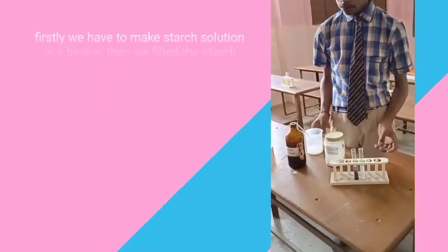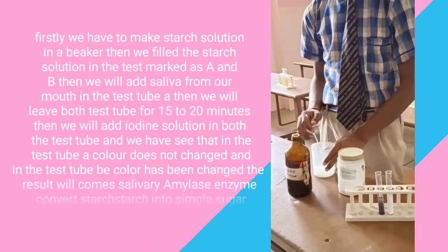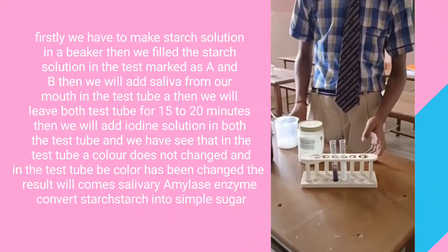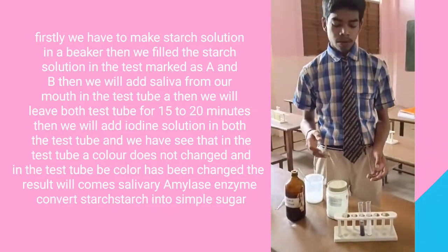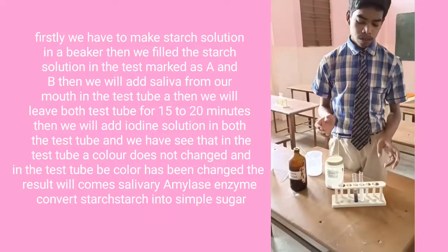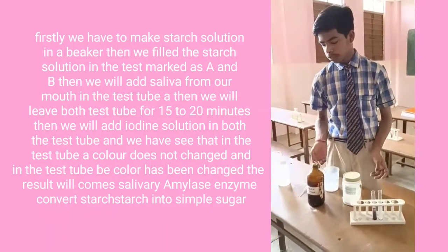Firstly, we have to make starch solution in a beaker. Then we will fill starch solution in both test tubes marked as A and B. Then we will add saliva from our mouth in test tube A. Then we will leave both test tubes undisturbed for 15 to 20 minutes.